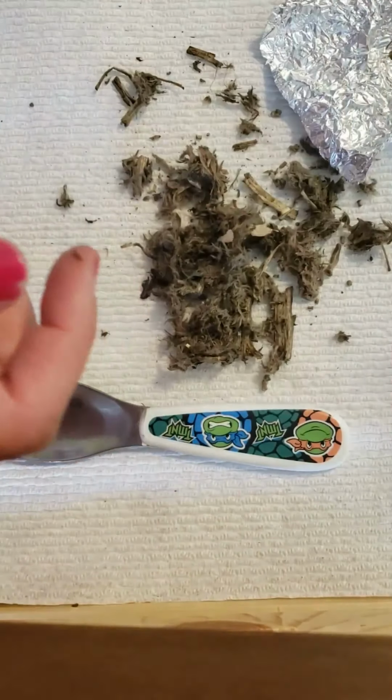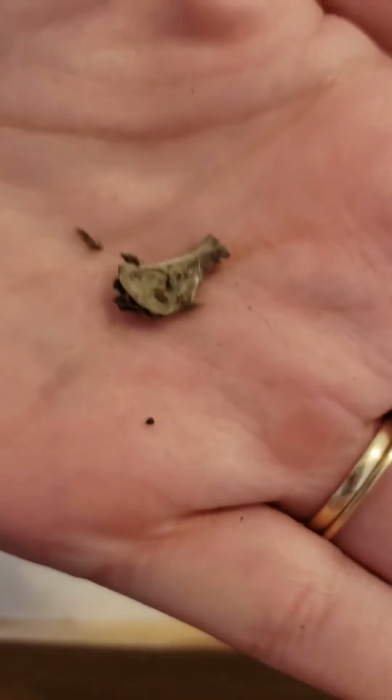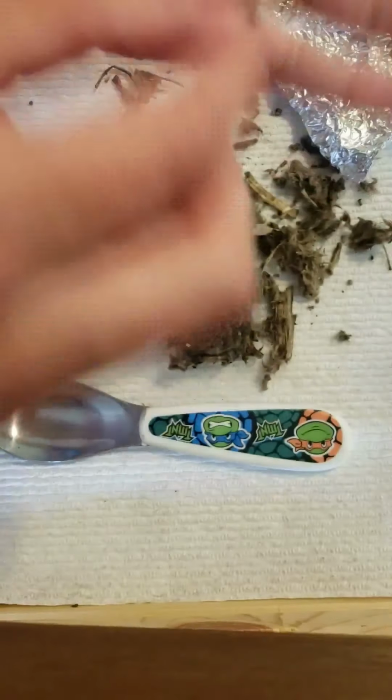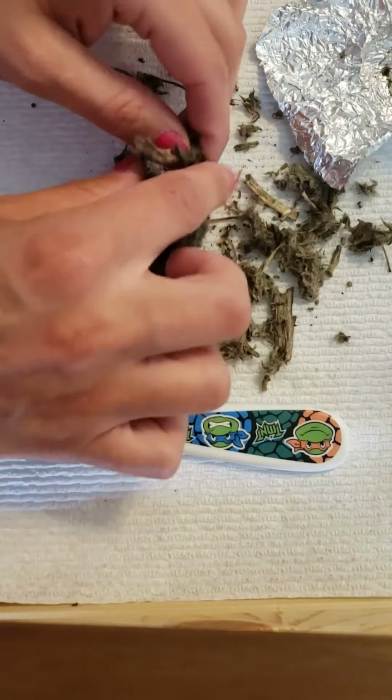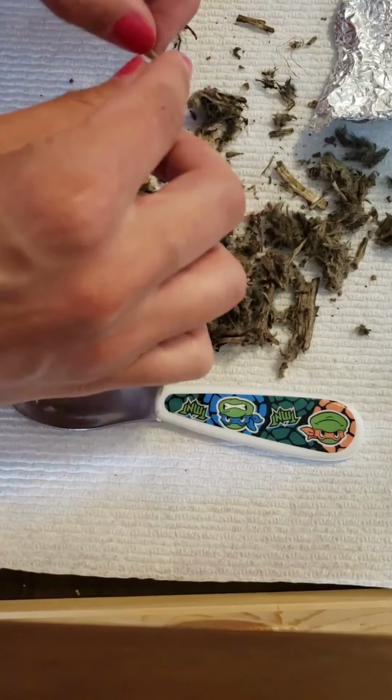And then Walty, what did you find, buddy? A bone. He found a bone too. Let me see if I can get that. There's the bone that he found. So I'm going to just skim through this one more time, really quickly, and then we'll do some classifying.